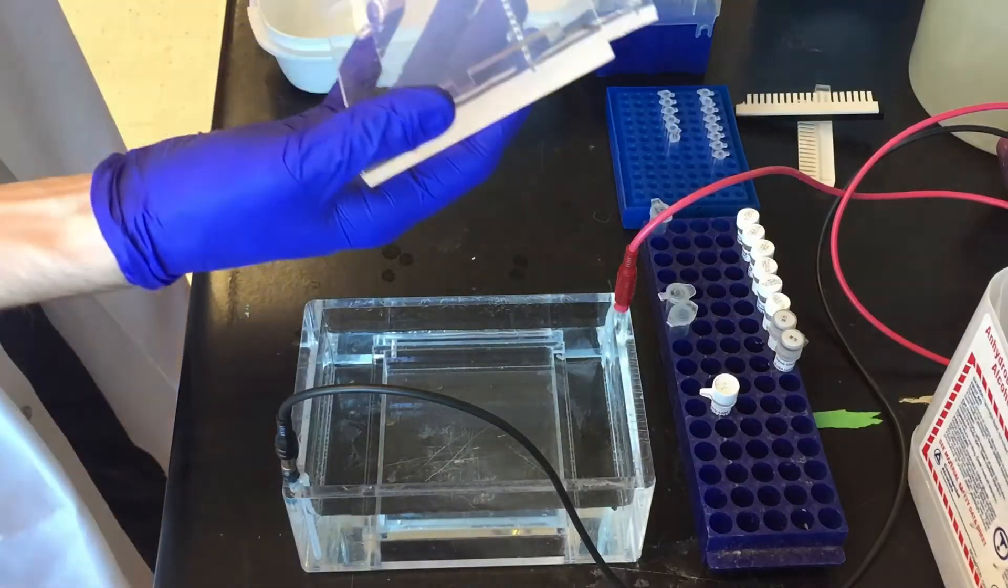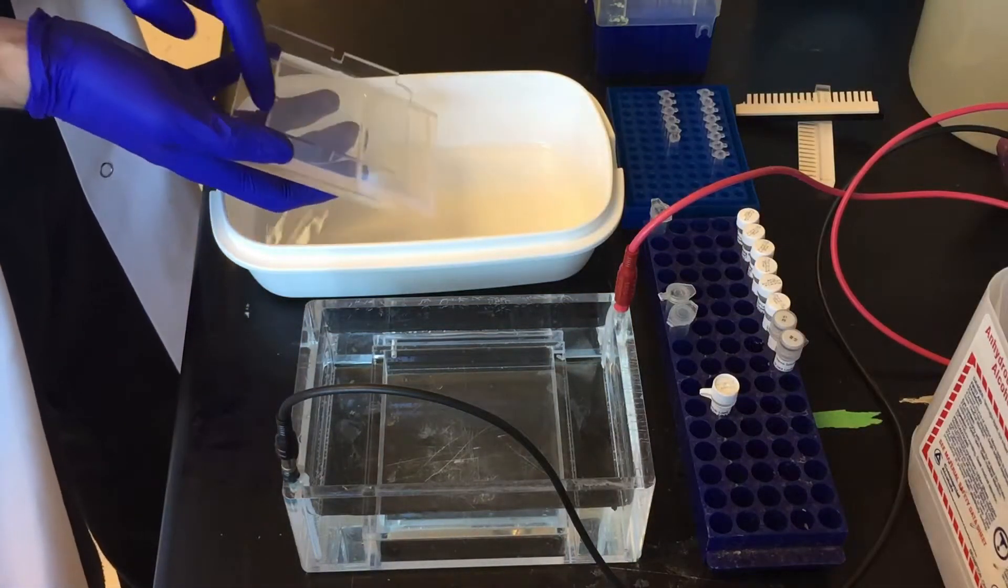You can cut the gel to the appropriate size depending on the number of samples that are being run.